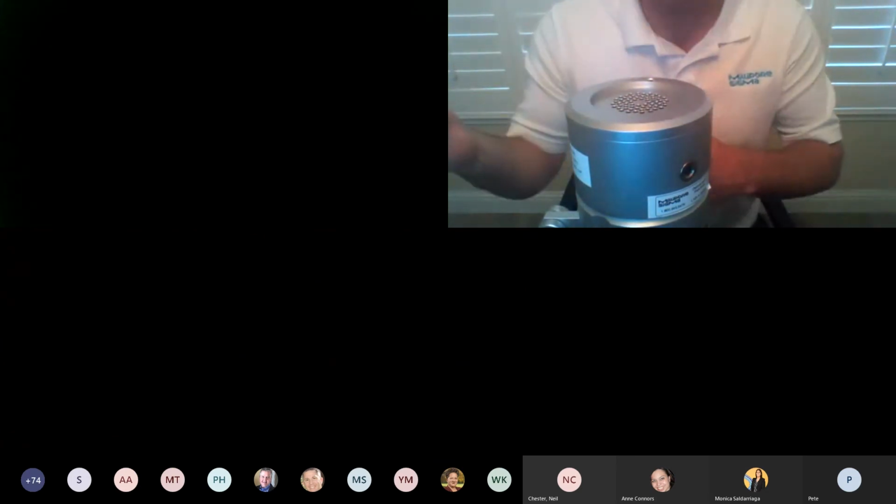So when you do your calibration, just have it sit, let everything warm up. And when you punch in your number at the calibration point, at the adjustment point, you'll see it go down to about 105. So you want to be right around 105. And when you calibrate it, you'll be at 104.7, 105.1. It usually should be pretty consistent.